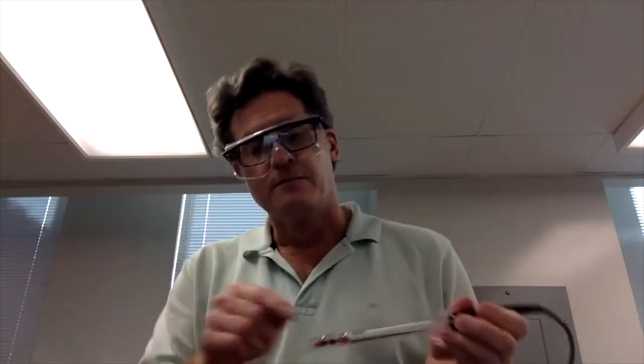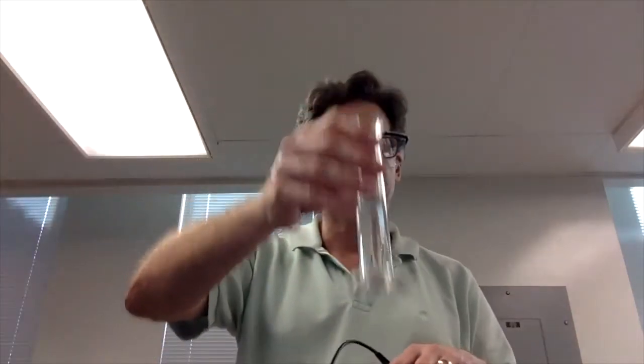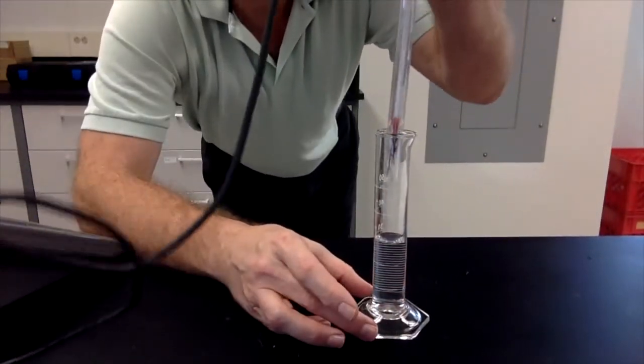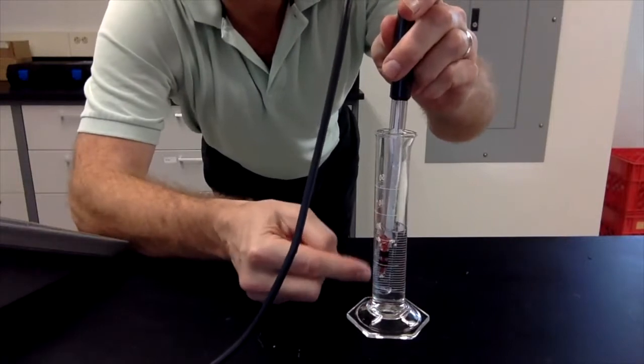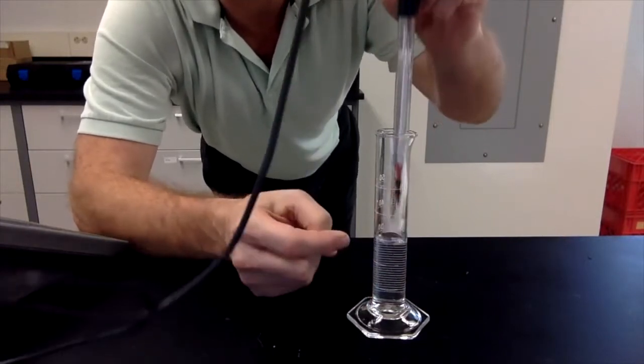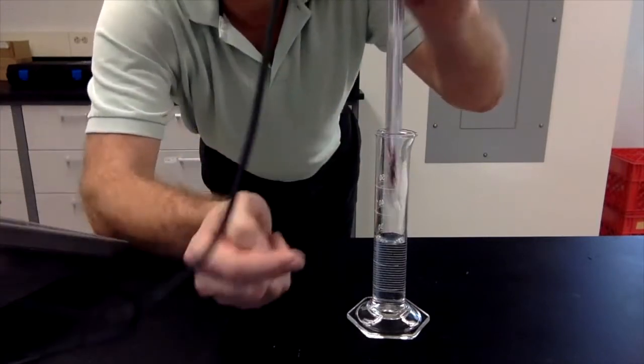That means that when you're doing measurements with this, it's very important that you cover the measuring bit. So we're going to use a graduated cylinder as our measuring device, because we need to completely cover the measuring part, which is not just the tube on the outside, not the tube at the very bottom, not like this.